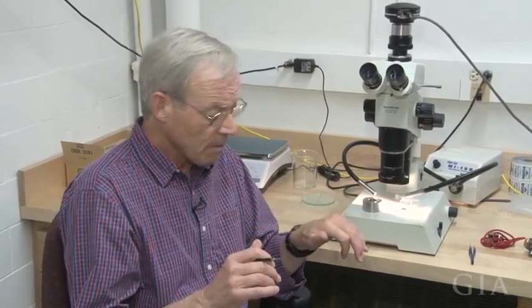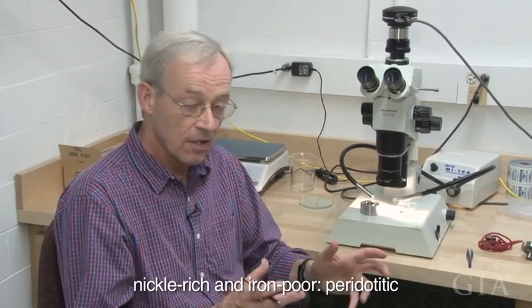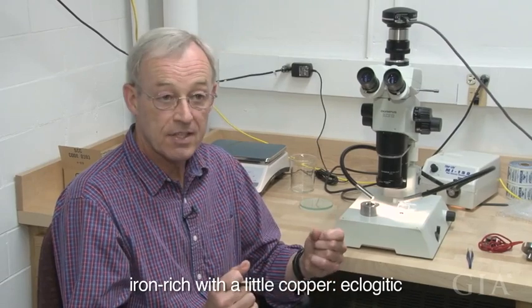So we want to make sure it's not any of the metal, but we also would like to see if the sulfide is nickel rich and iron poorer, or it's iron rich and has a little bit of copper. And that would be the difference between an eclogitic or a peridotitic inclusion. So if it's got the higher nickel, it would be peridotitic. If it's got the lower nickel and higher iron, it would be eclogitic.